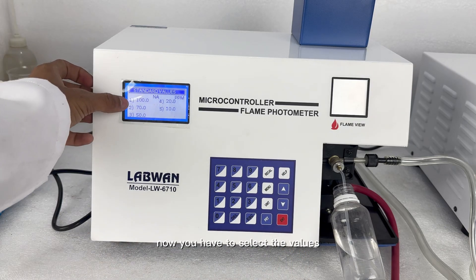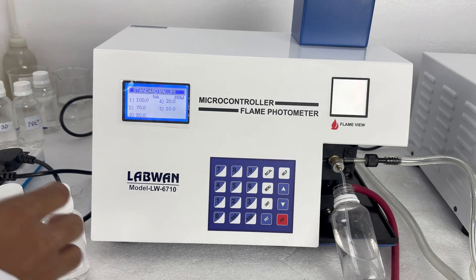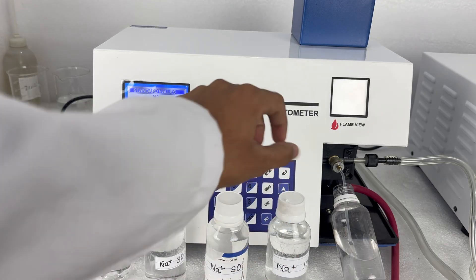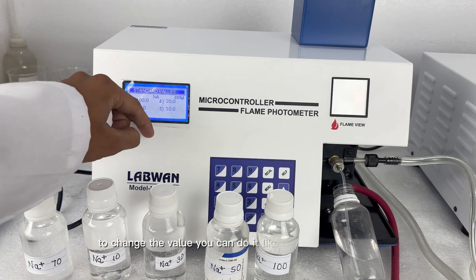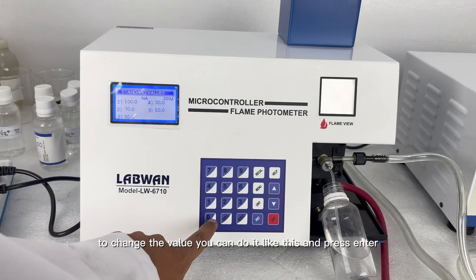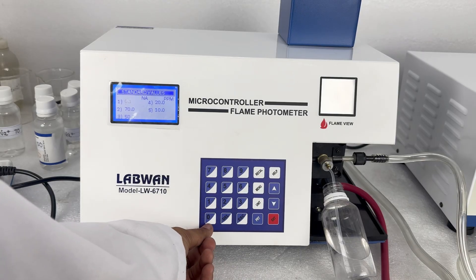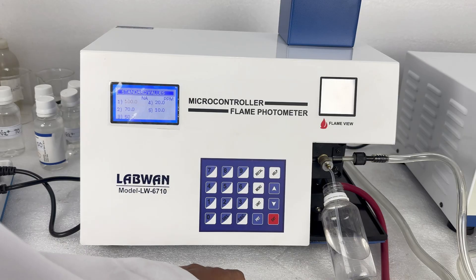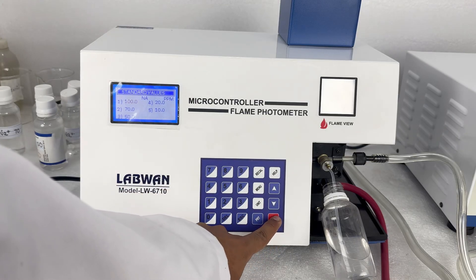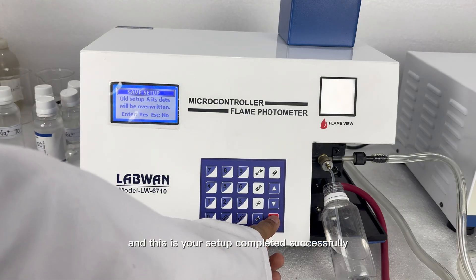Now you have to select the values — you can select them as per your choice. Here I am selecting values as per my choice. To change the value, you can do it like this and press enter. And this is your setup completed successfully.